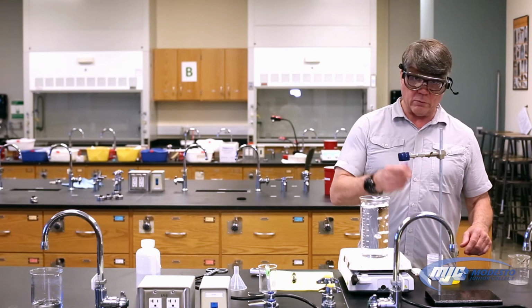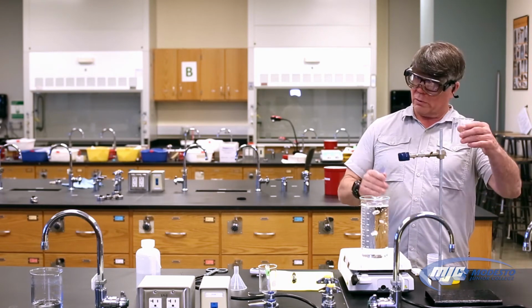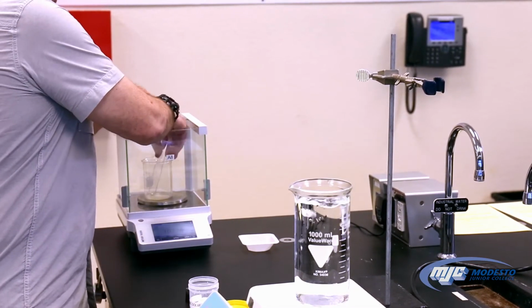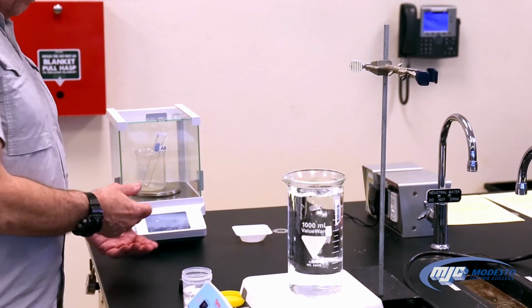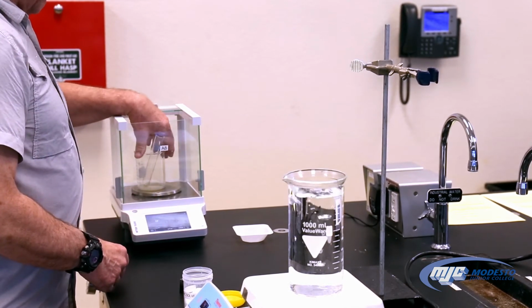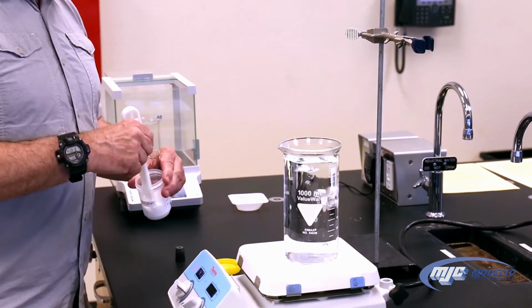Now, we're going to use a large test tube. We don't care how much the test tube weighs. We're going to put it in a beaker. We don't care how much the beaker weighs. So we put the beaker with the empty test tube on the balance, just like before. Close the door. We tare the balance. So now the balance should say 0 with the beaker and the test tube on it. Once we do that, we take it out, so it's zeroed out, tared out, and we're going to fill this guy up pretty much all the way.